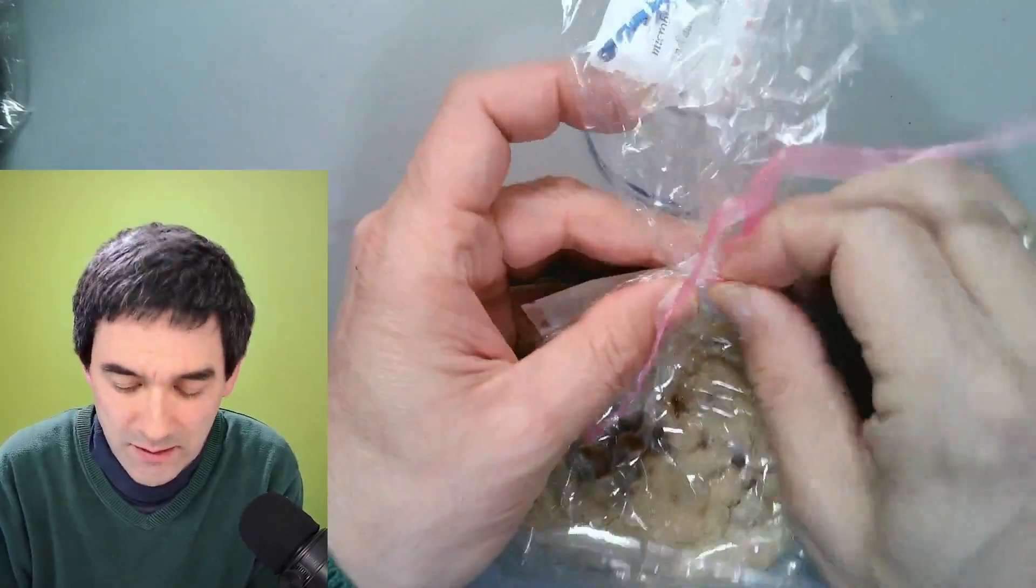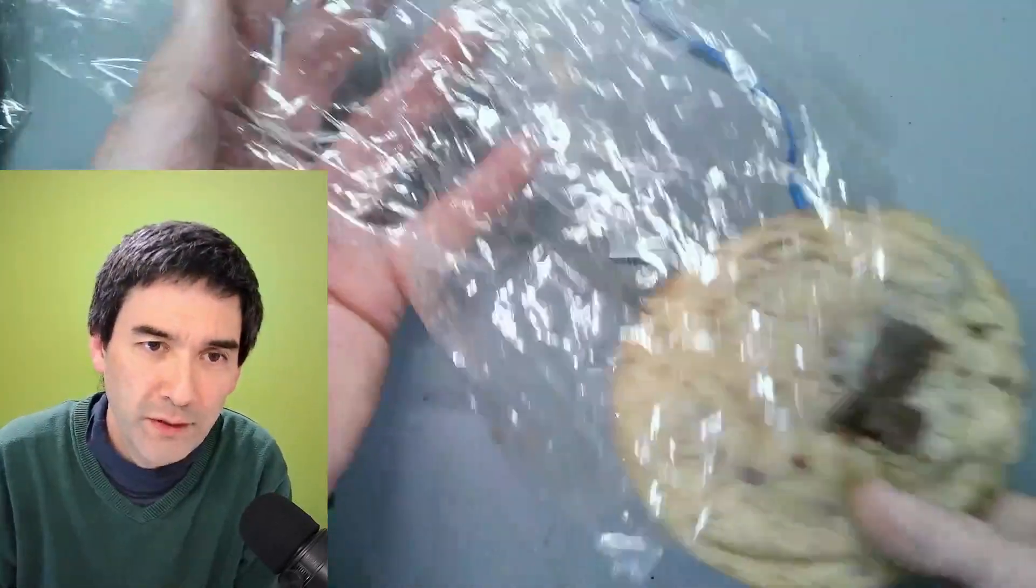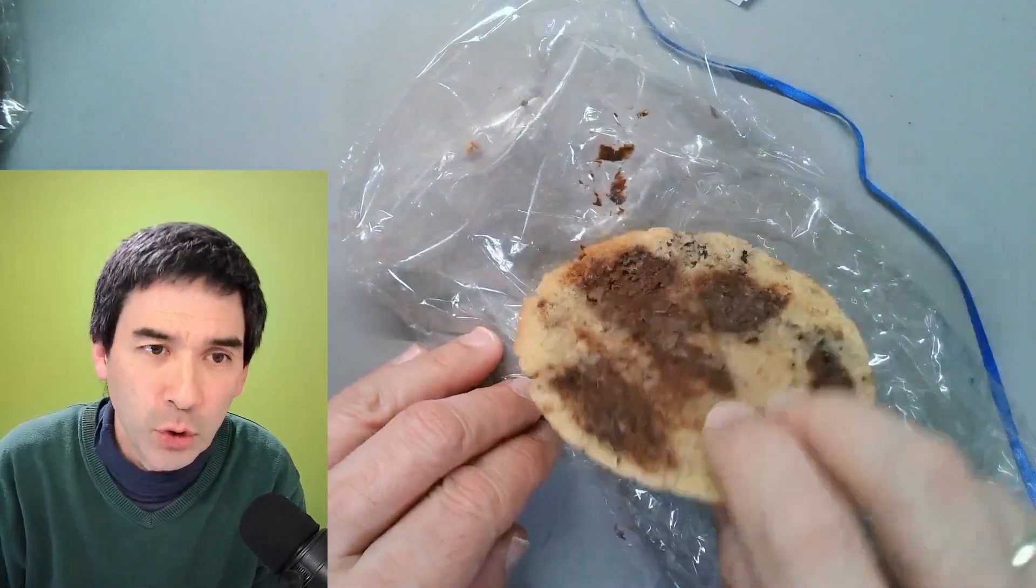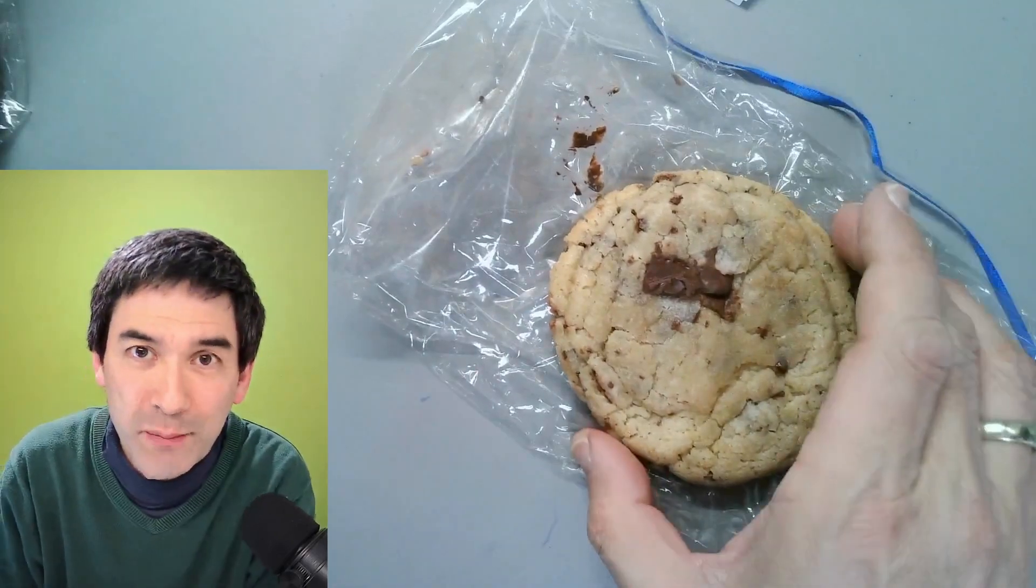Let's open it. Carefully remove it. Here we go. There's also some chocolate here. The students really spent a lot of time baking those. Let's put it also under the microscope.